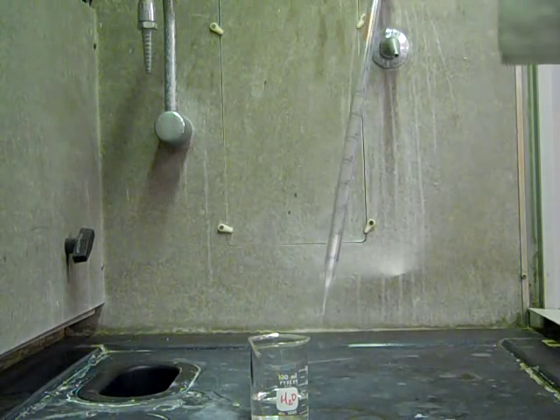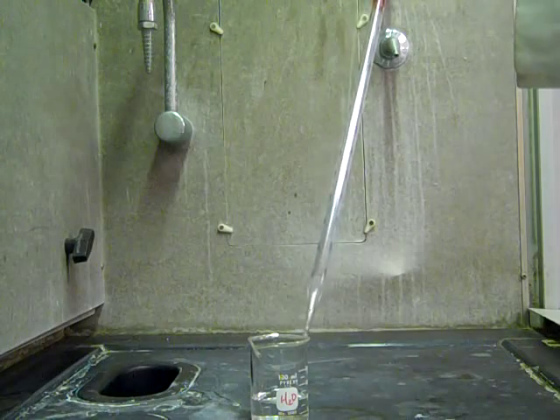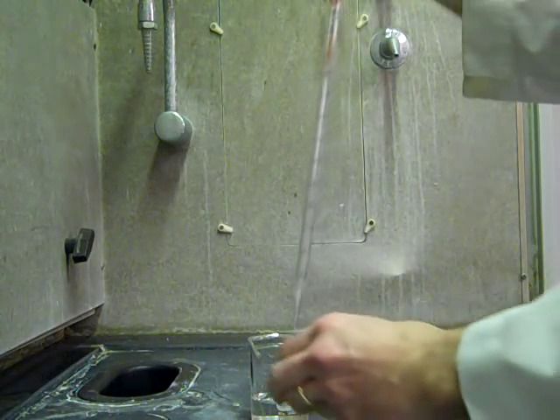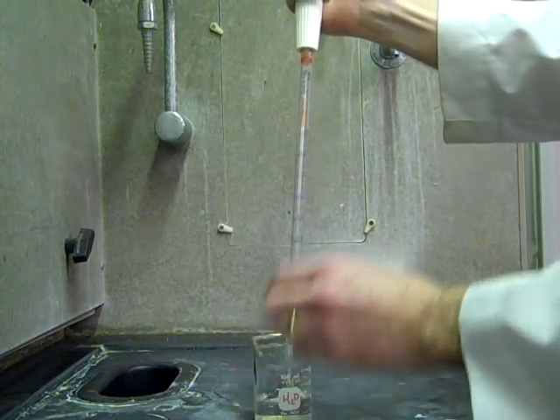Now just in case some of you have forgotten how to use the graduated pipette to suck up water and then dispense it, I have here distilled water.